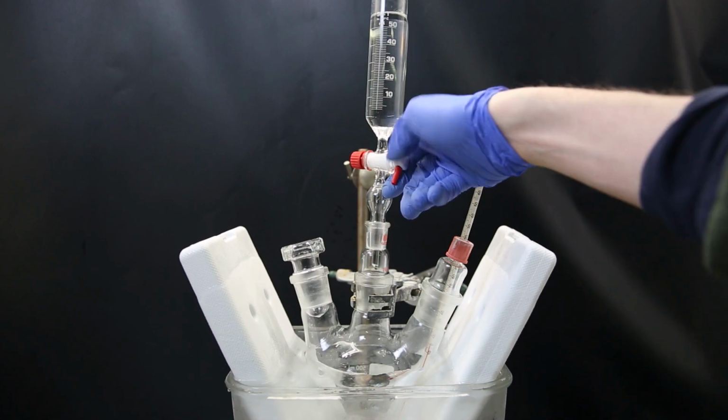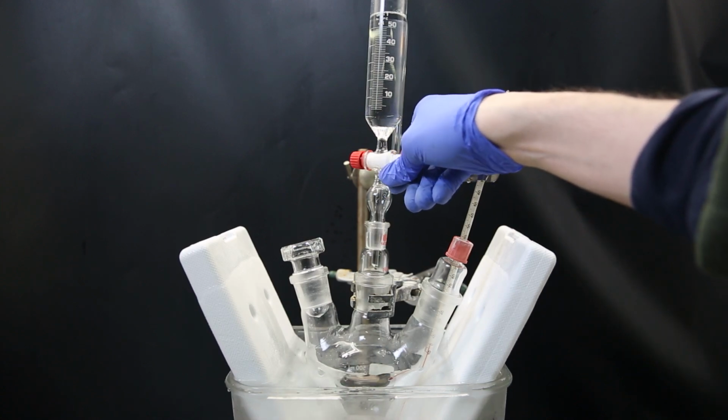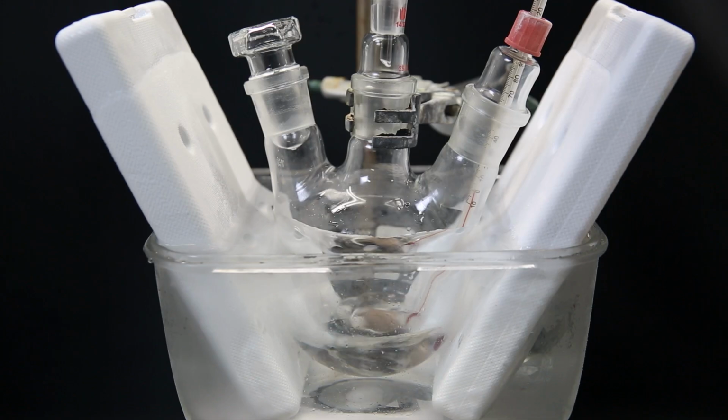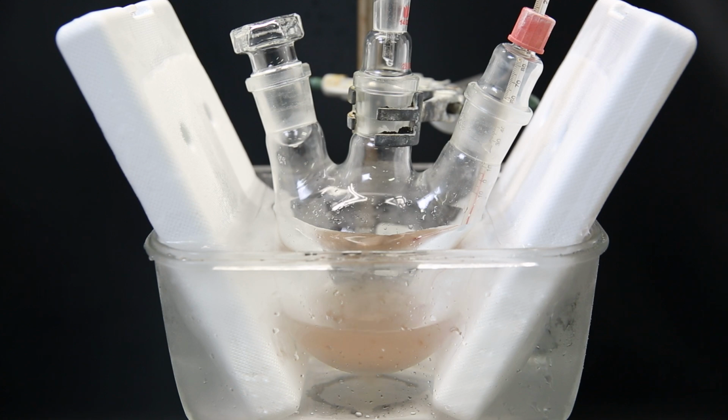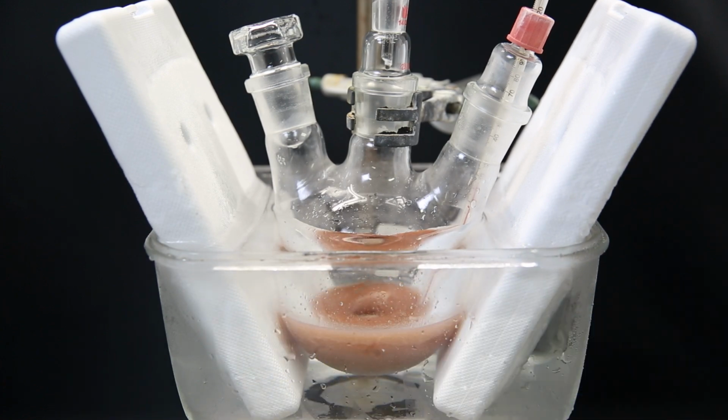I then slowly add the acid mixture to the mesitylene in the flask, while keeping the temperature at or below 10°C. There is barely an exotherm during most of the addition, and I can add it at a normal pace. After a while, there is a slight exotherm, and the temperature increases to 10°C and stays there for some time. The mixture keeps stirring normally, and it doesn't get stuck like before.